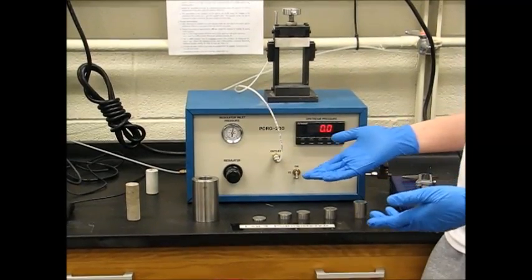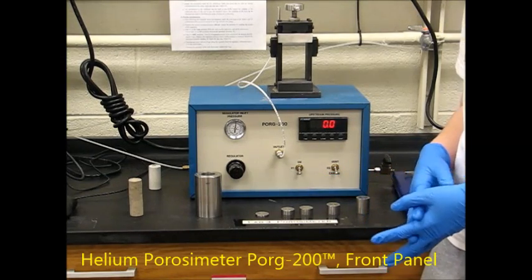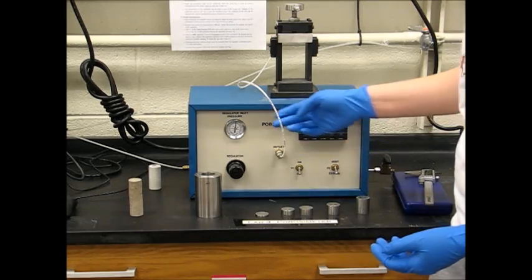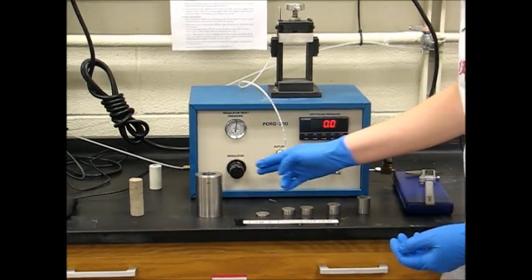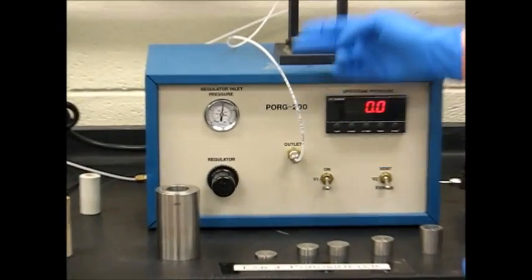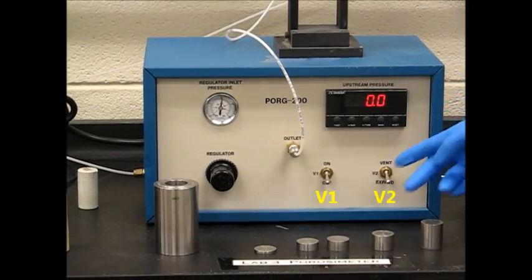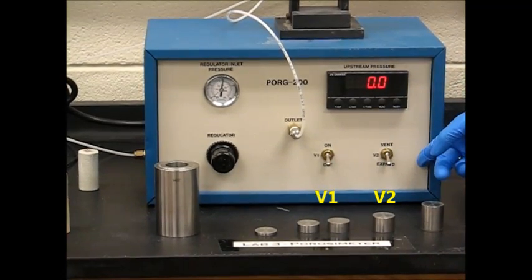This is the front panel of the Helium Porosimeter Porg 200 made by the Core Lab company. We see here that we have a pressure gauge, a regulator which controls the pressure gauge, the outlet valve which connects to the matrix in our sample, our readings, and a valve 1 and valve 2.